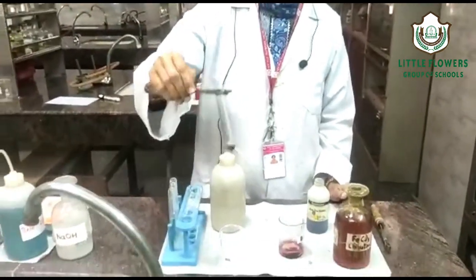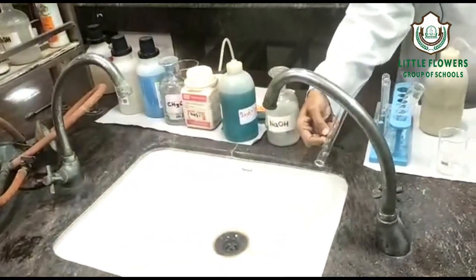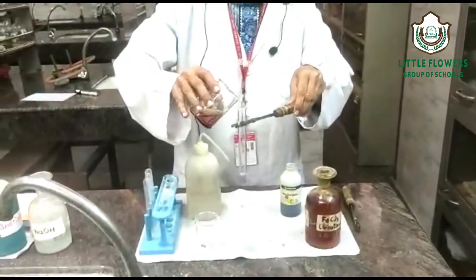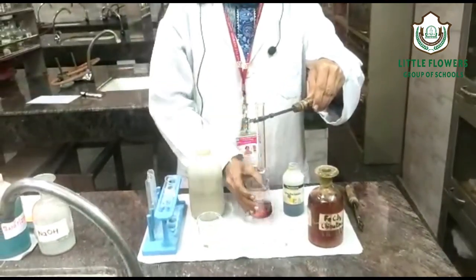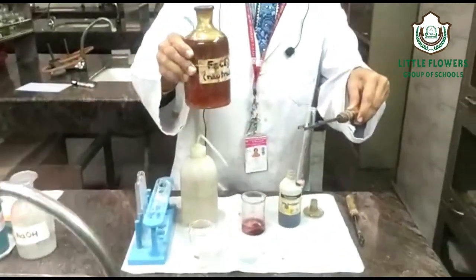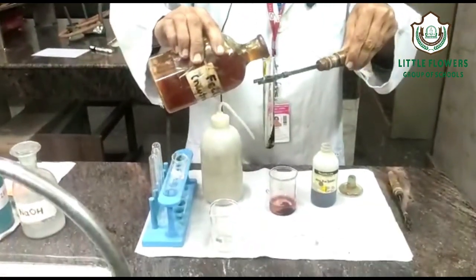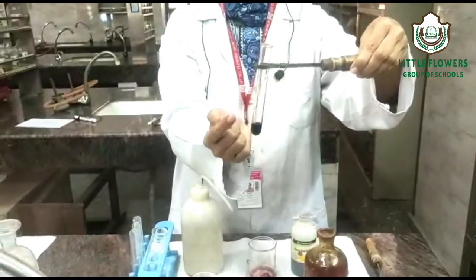After that, we do the confirmatory test. For the confirmatory test, we take the organic compound again in a test tube and add neutral FeCl3. See — a dark purple color appears, which confirms the presence of the functional group.